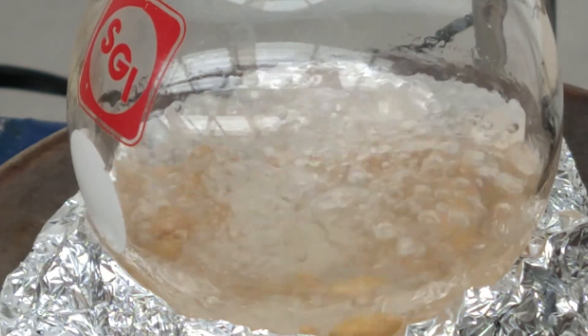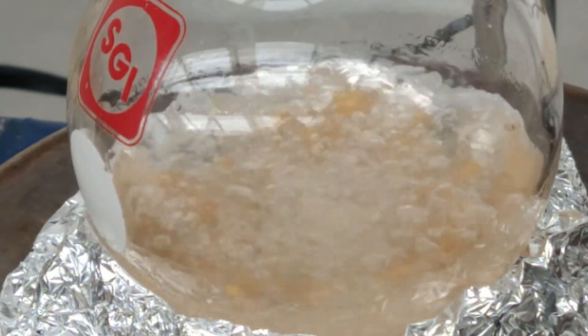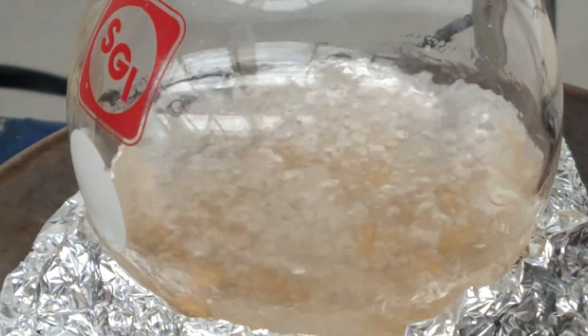Now we have to let the reaction proceed at this rate for about one to two hours or until the sodium gets dissolved.